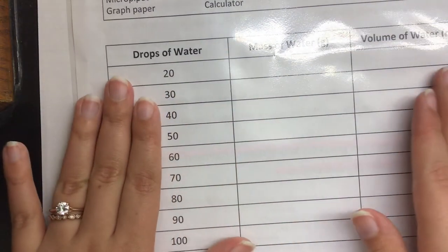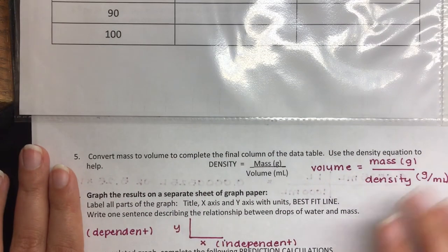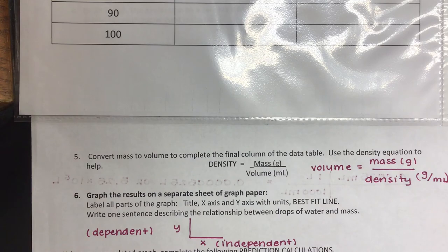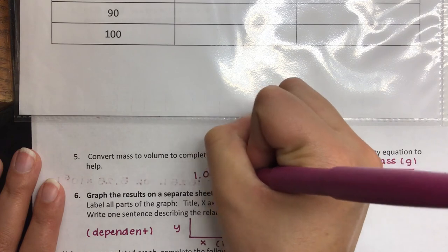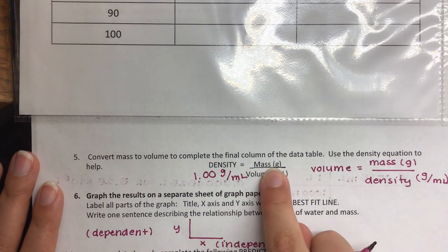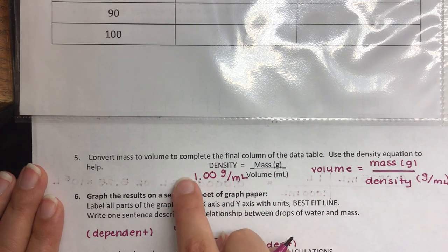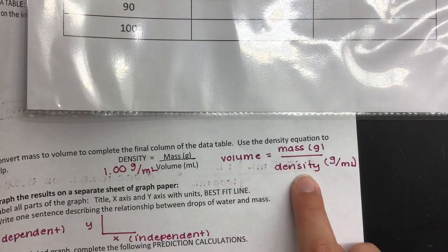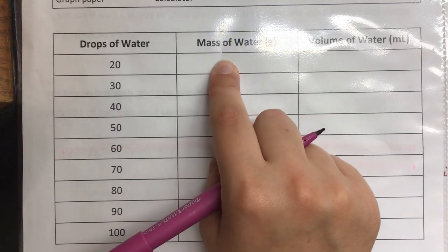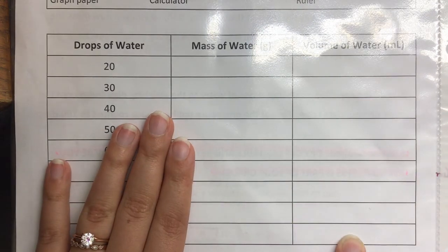Now I need to fill out the volume column. To do that I will use my density equation. I know density to be 1.00 grams per milliliter, and I found my mass in the lab. So, rearranging the density equation, I get: volume equals mass over density. I will take my mass of water and divide it by one to get the volume of water, then record that entire information in this column.